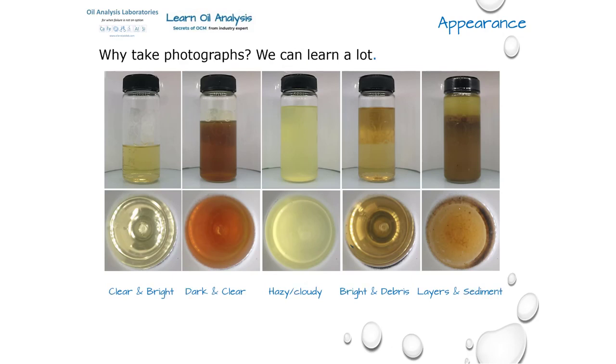So from left to right we have a clear and bright sample, a dark and clear sample, and a hazy or cloudy sample, but still free of particles. A little tip for you here: I personally use a line on the floor of the camera rig to see if I can see through. So for example, in the first picture we can see through, but in the third picture we can't. In the fourth sample we can see a few specks of debris, but you may have been fooled into thinking that there is a layer on the sample, but that is in fact just a shadow from the sample label you can see. The final picture has two layers, and it is mostly water and a visible sediment at the bottom.